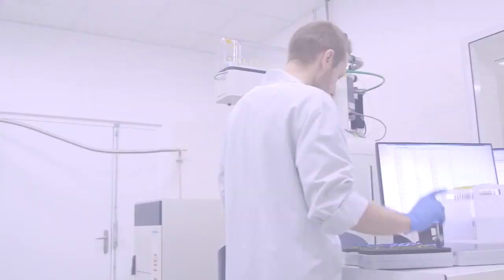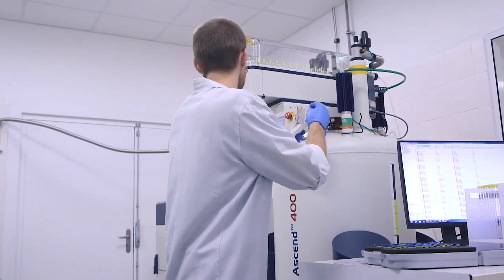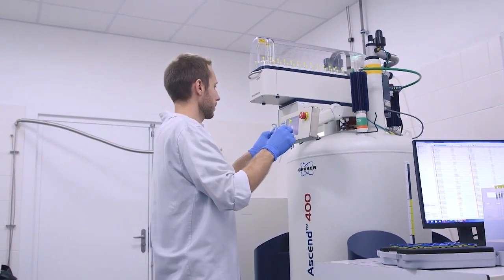Transferring samples into the auto sampler is straightforward, as the next empty holder slot is automatically moved to the insert position.